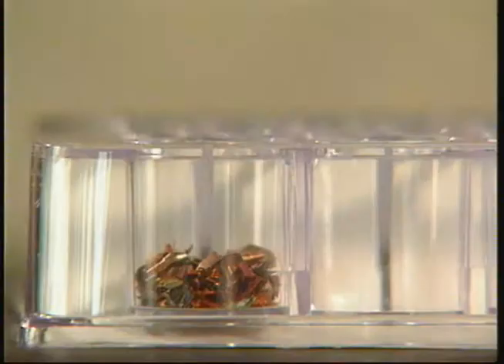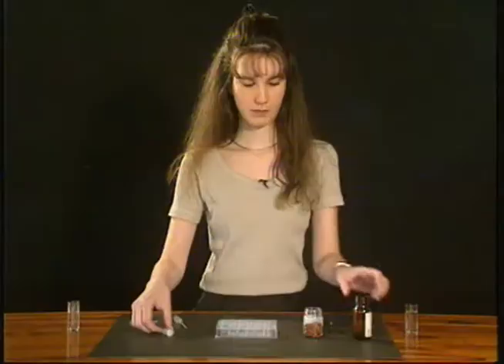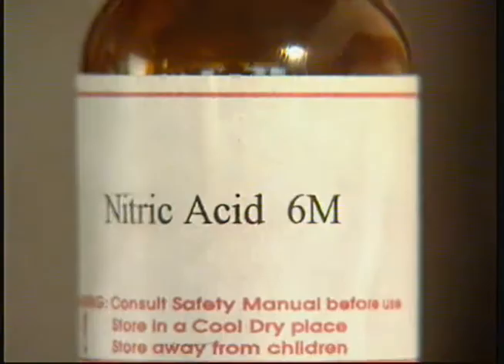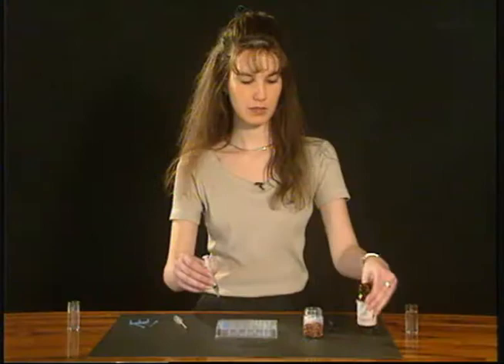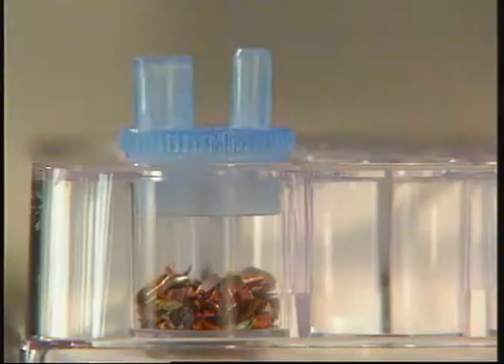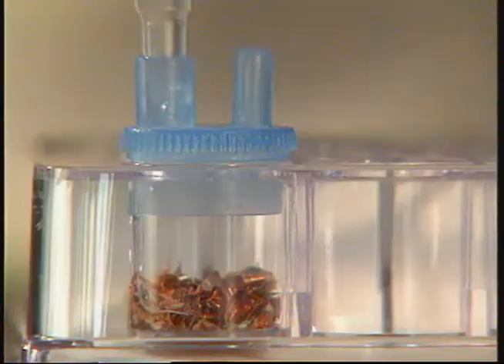Put lid 1 on well F1. Fill the syringe with about 0.5 mils of 6 molar nitric acid and insert the nozzle of the syringe in the syringe inlet on lid 1. Slowly add the nitric acid from the syringe to the copper turnings in well F1.